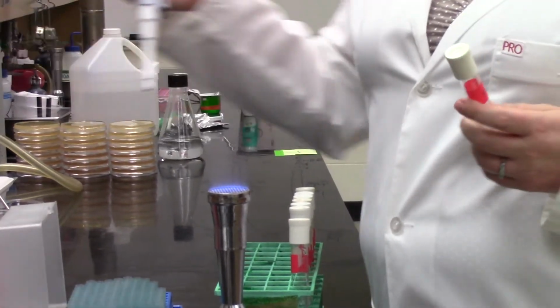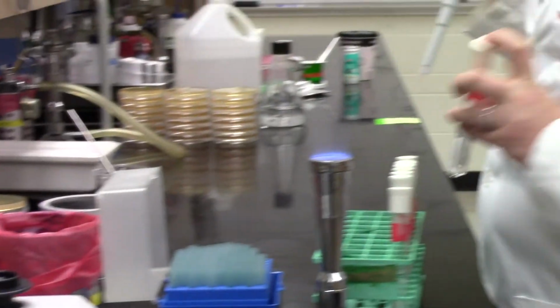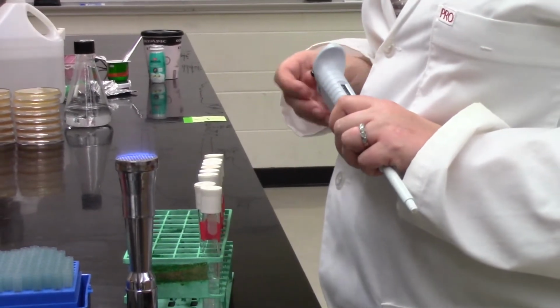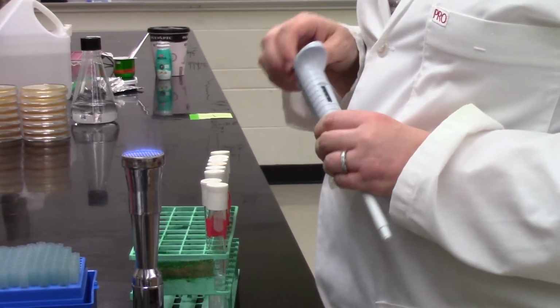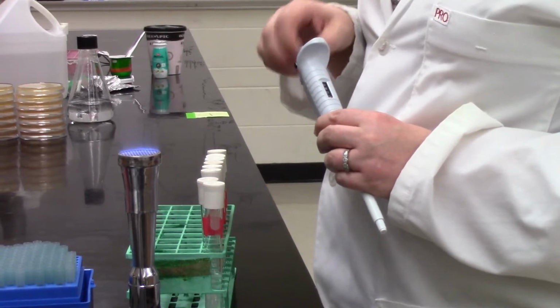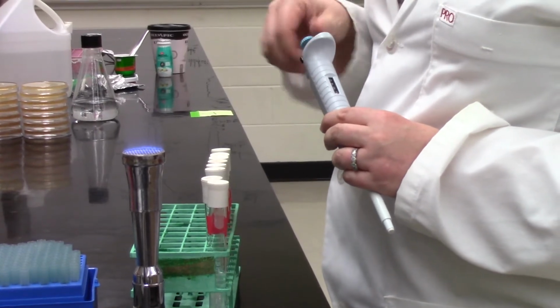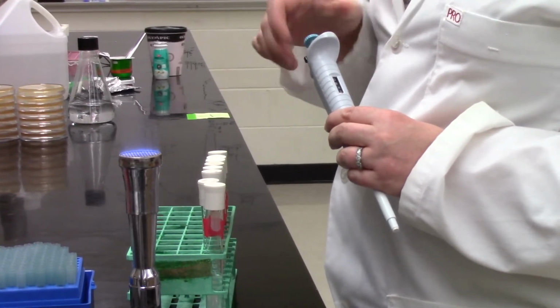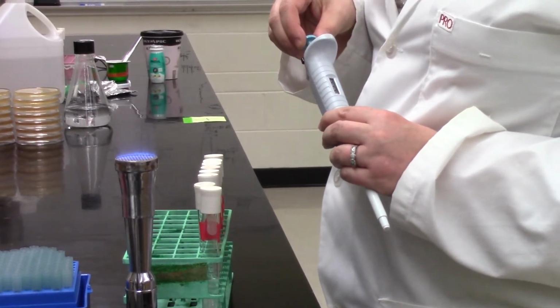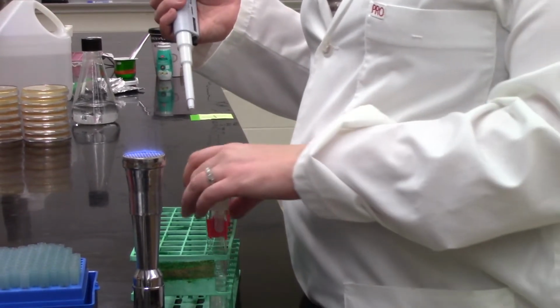We do these big dilutions up front because we know from experience that the number of bacteria in that capsule is such that if we just started spread plating bacteria that were only diluted 10 to the minus 2, only 100-fold diluted, we get a lawn of bacteria. So we're not going to start our smaller steps in our dilution series until now, when we hit the 10 to the minus 4 dilution. From here on, you can see Sabrina's readjusting her pipette because she's going to start making tenfold dilutions.